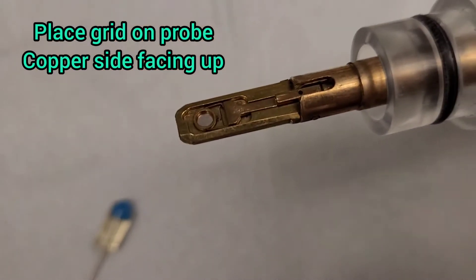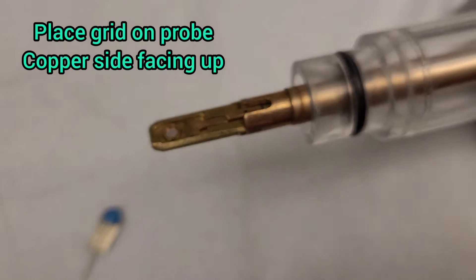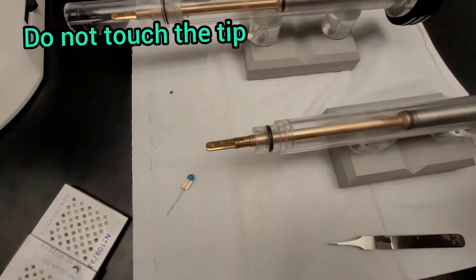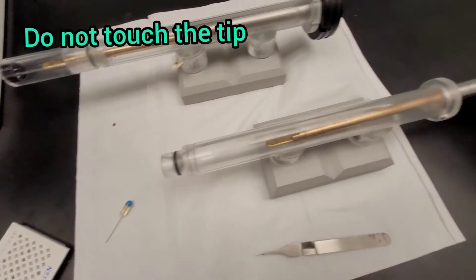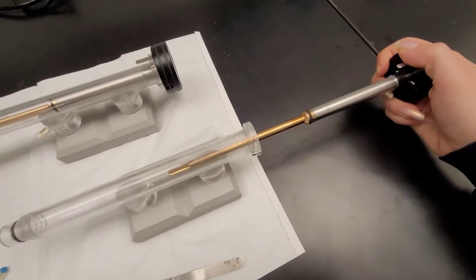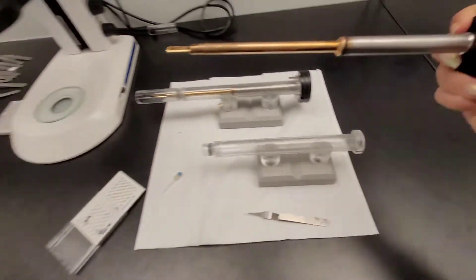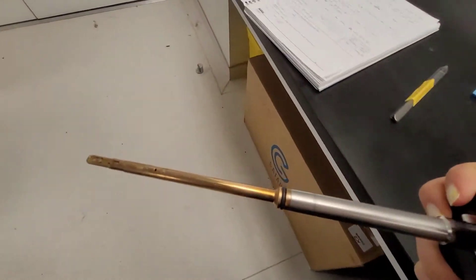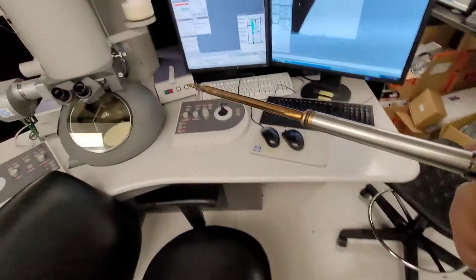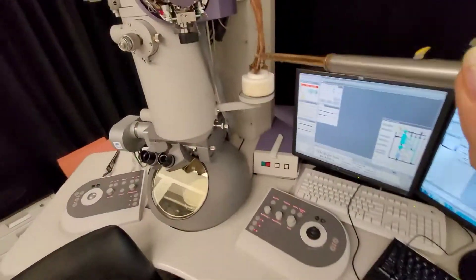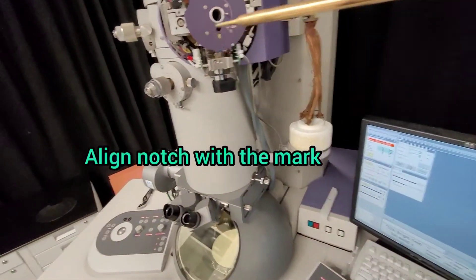The important thing is to never touch the tip of the probe. This is a big no-no. This is why it has this specific holder, and you should always hold it from the end and never touch especially the golden region.